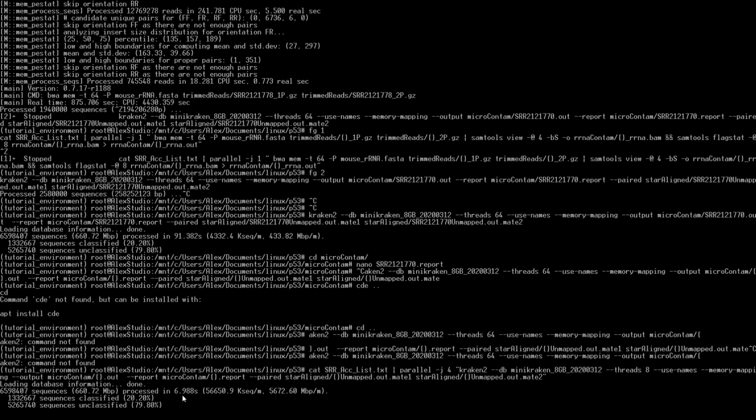contamination. That was much quicker. That took about 7 seconds. I ran it before without the memory mapping, and it took about 25 seconds or so to do each. Read in a lot. 56 million reads per minute. But so that's checking for contamination and everything. I can post all the links and stuff down below too. That way, if you guys want to go through and read some more about them, you're absolutely welcome to. But that's it for this time.